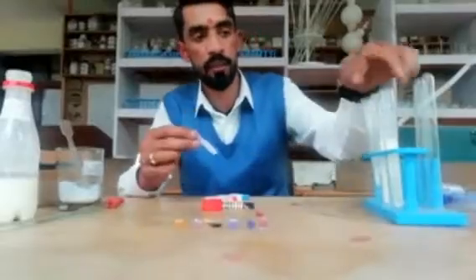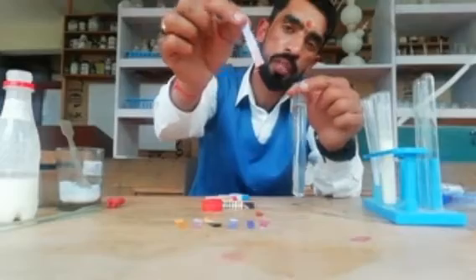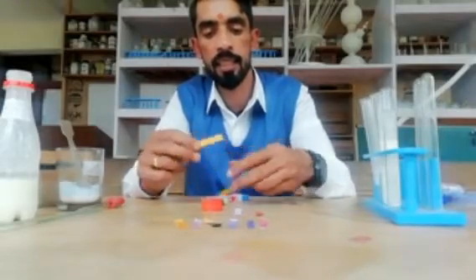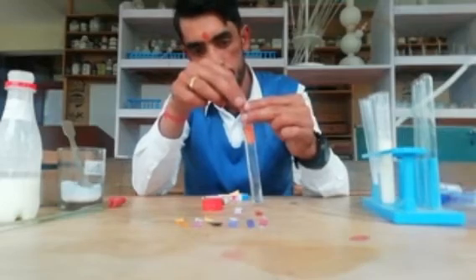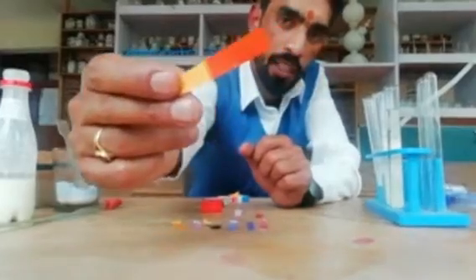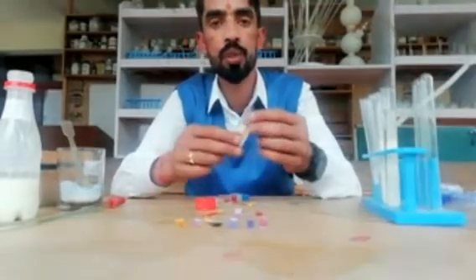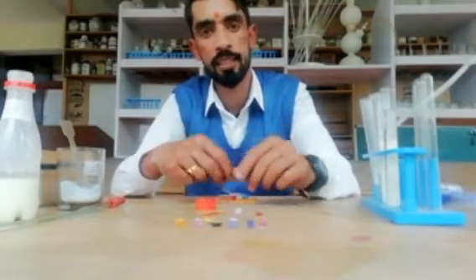Now we will check it with blue litmus. Obviously, blue litmus is going to change into red. You can see the magic — blue litmus changes into red. This is another example showing that vinegar contains acid. Now with the pH paper, it changes to a light orange or yellowish-orange color. You can see the pH is between two and three — less than seven — so this is also acid.